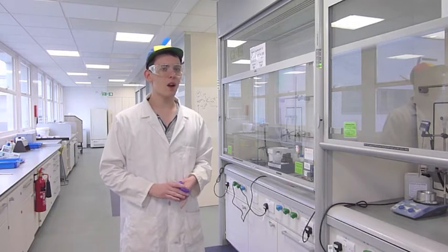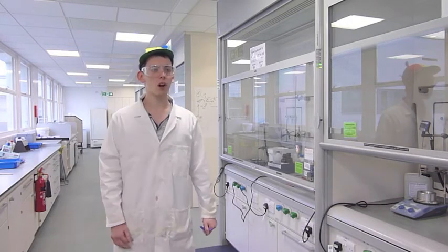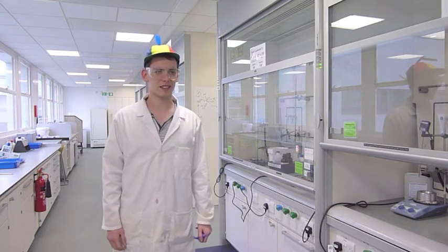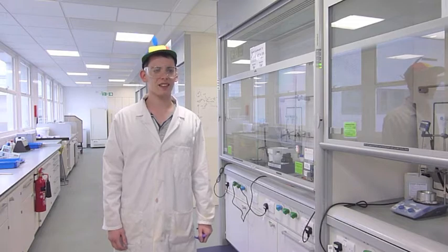Today, Johnny, you're doing the reaction of a tertiary alcohol with concentrated hydrochloric acid. Whoa, swell! Where's my equipment? Don't worry, Johnny. We've got a glamorous assistant who's bringing it to you right now.